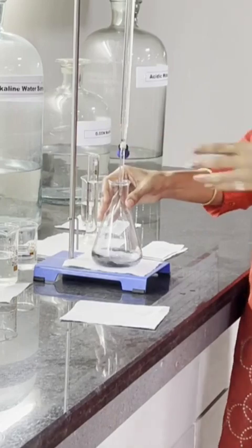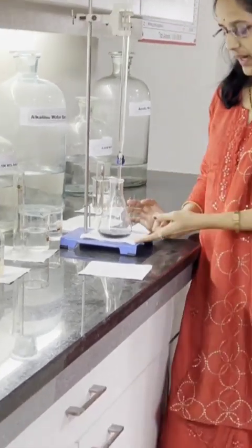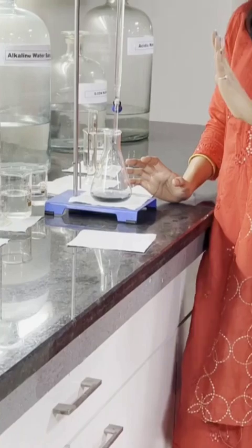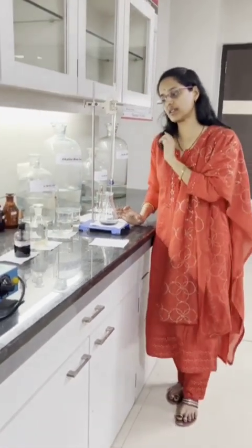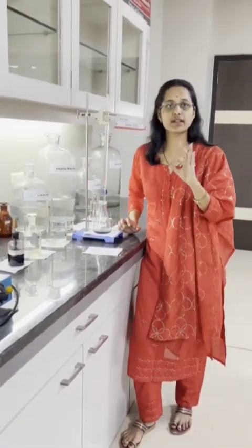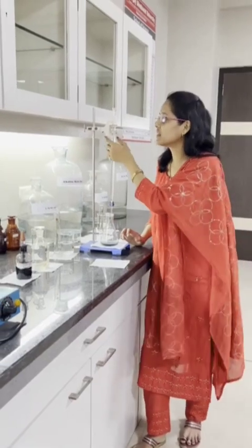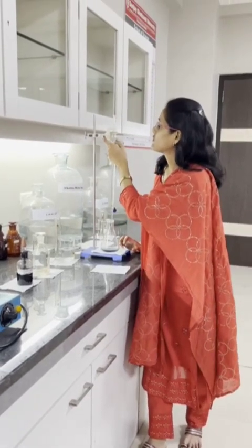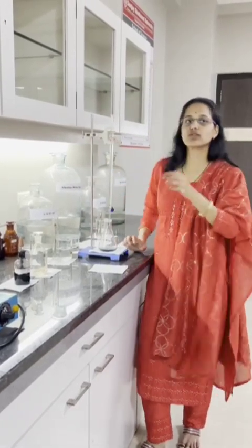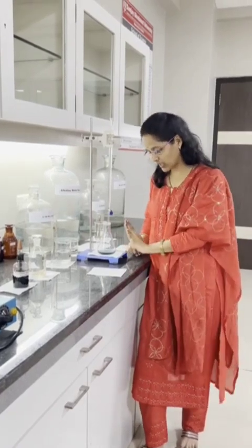You can easily see the color change — wine red to sky blue. We have to repeat the same process twice so you will get 3 readings. This reading is 4. This is 4 — meaning this is the total hardness.